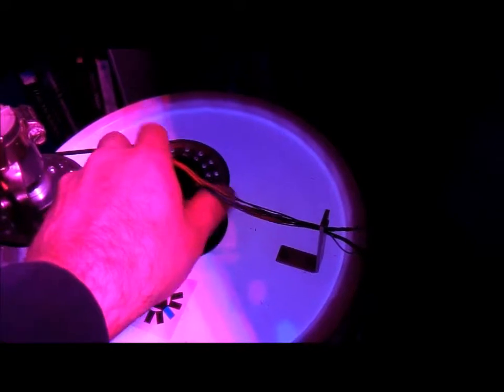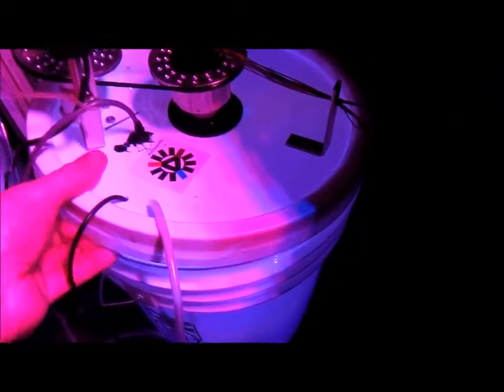And then inside of this there is a light bar. I'll show you real fast right there. And then down at the bottom you can also see the air stone coming in, and that's so we can bring air and CO2 into the algae.